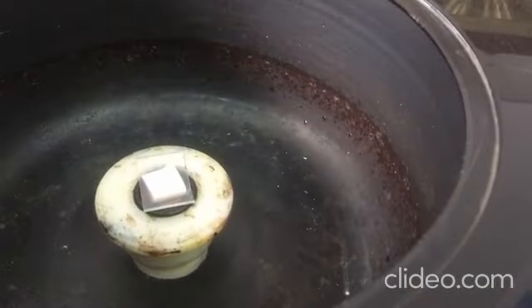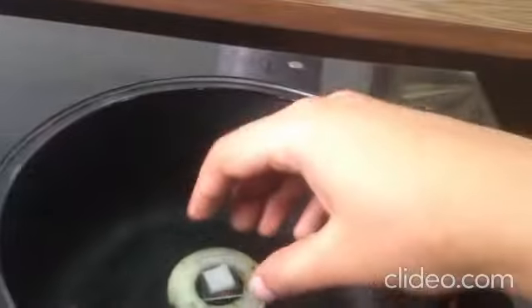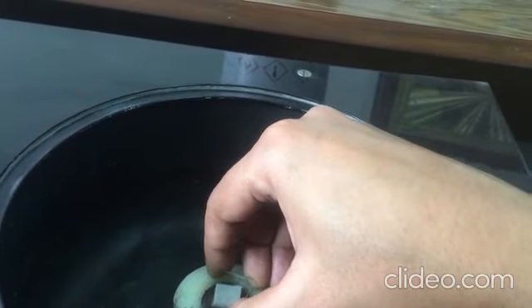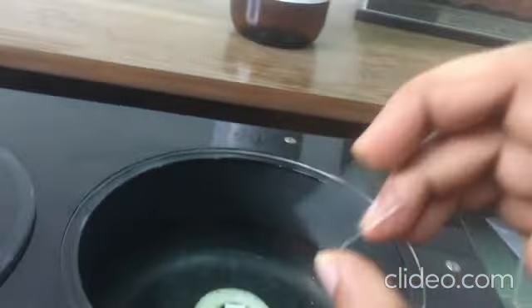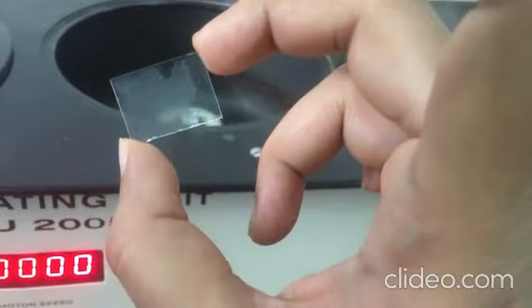After 30 seconds the motor stops rotating. You can see your sample - this is a spin coated sample.